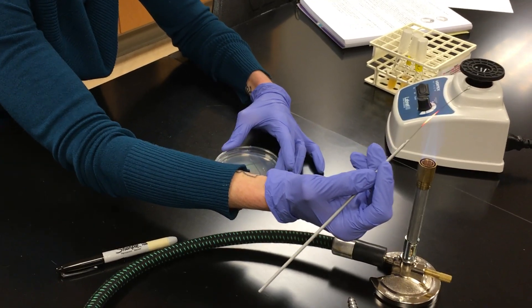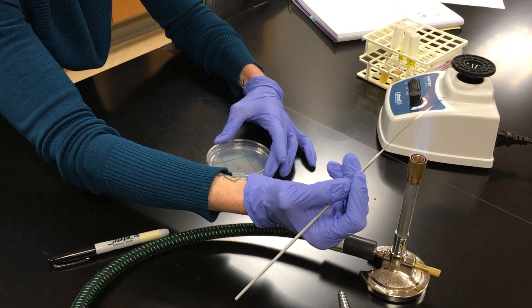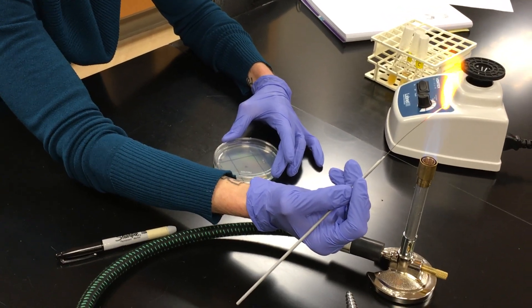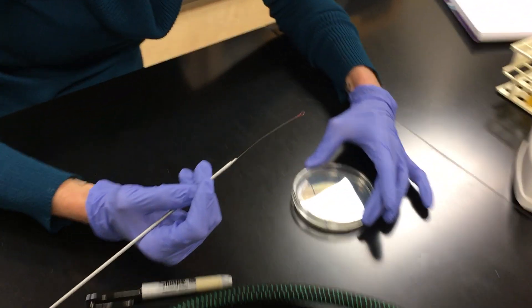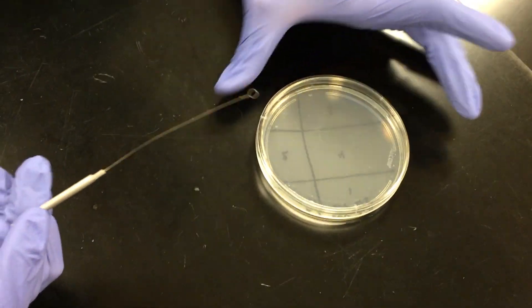Flame. Once again, from the base to the tip, it glows. Microbiology is fun. And then I'm going to rotate. So I rotate it.